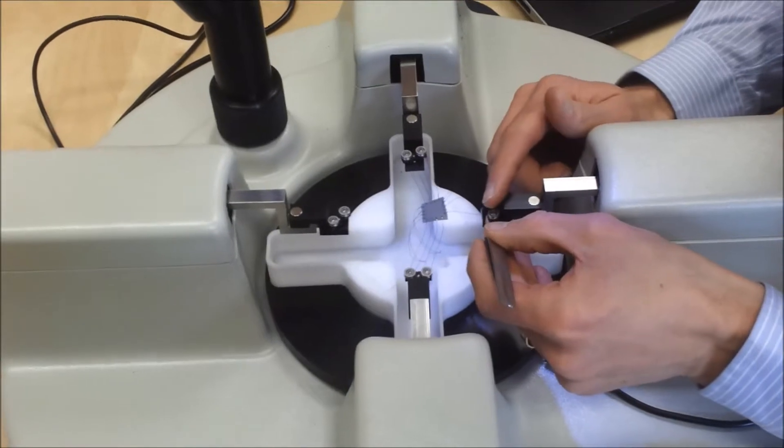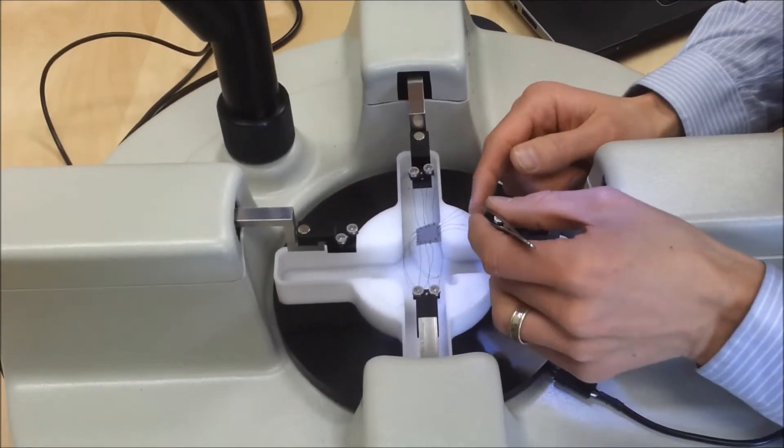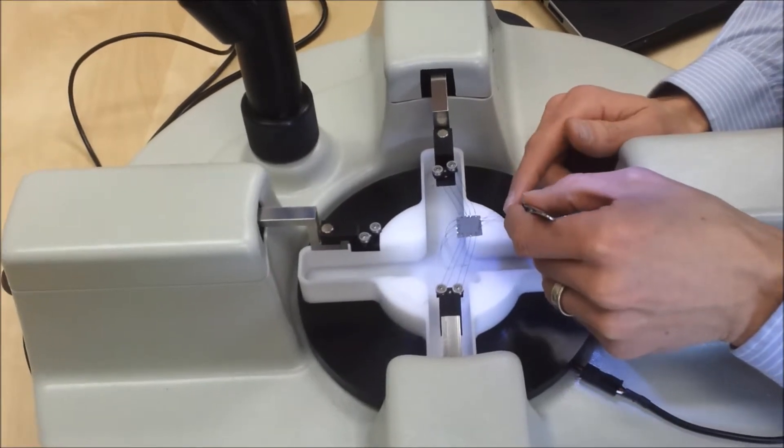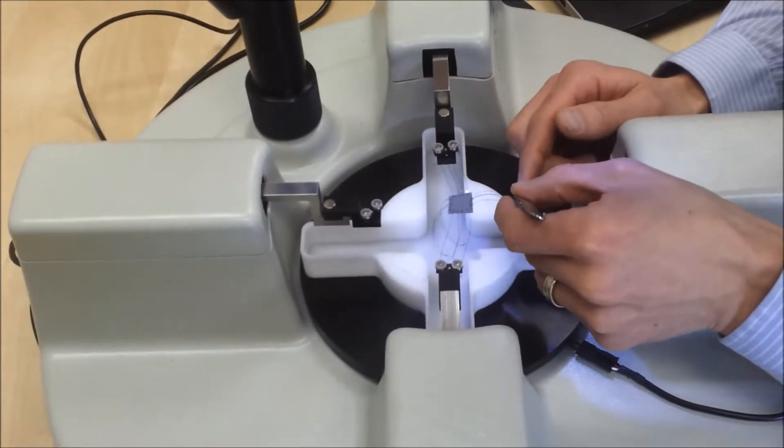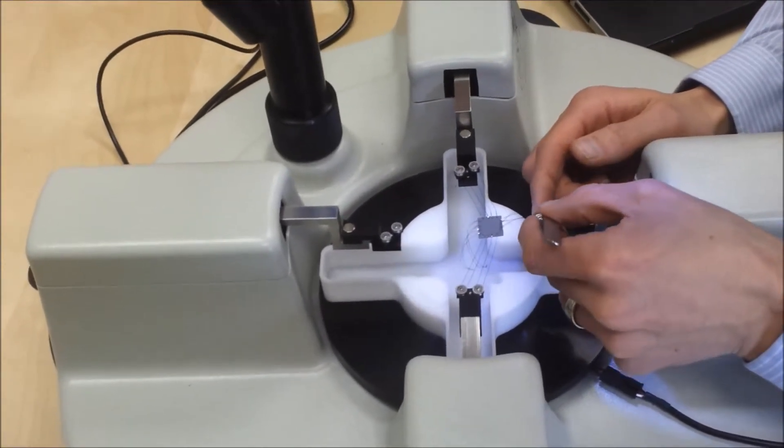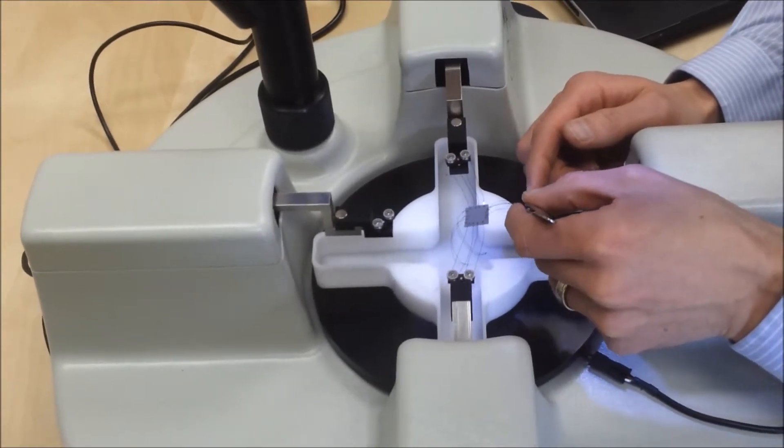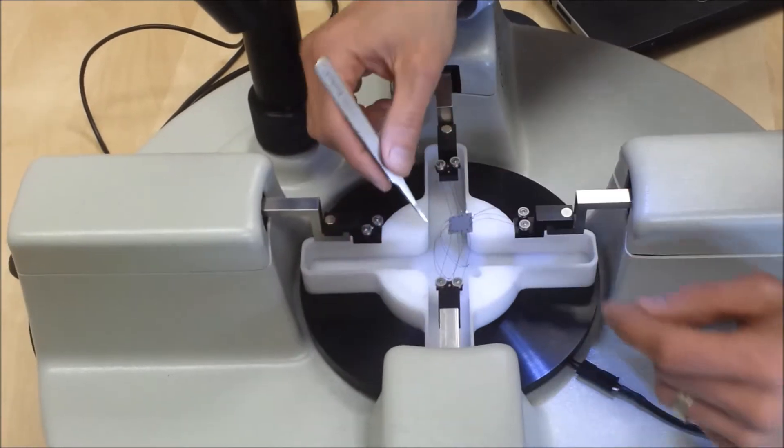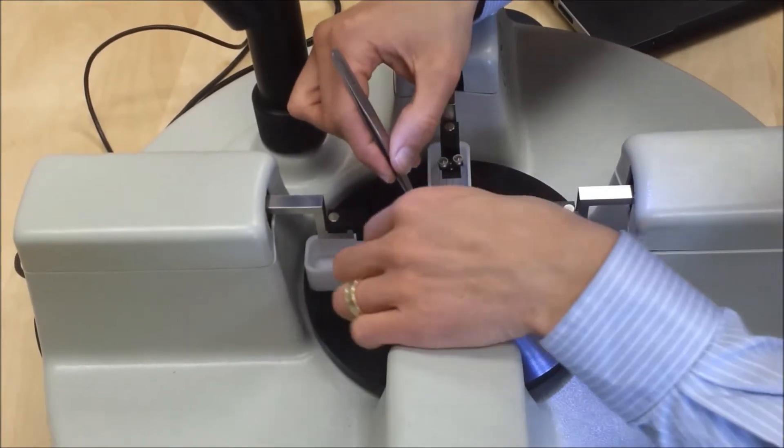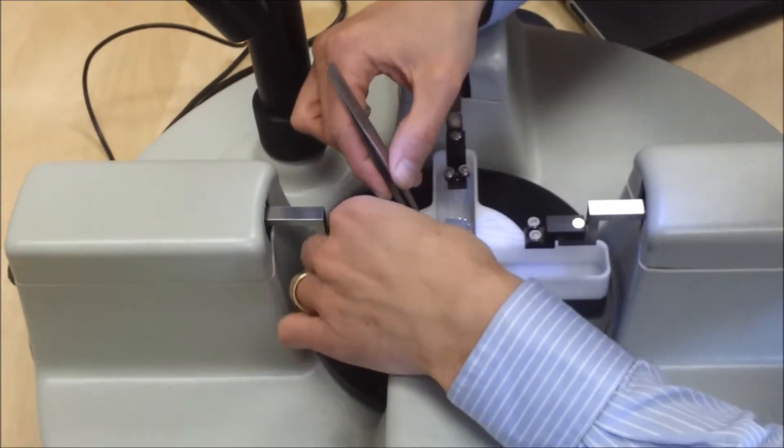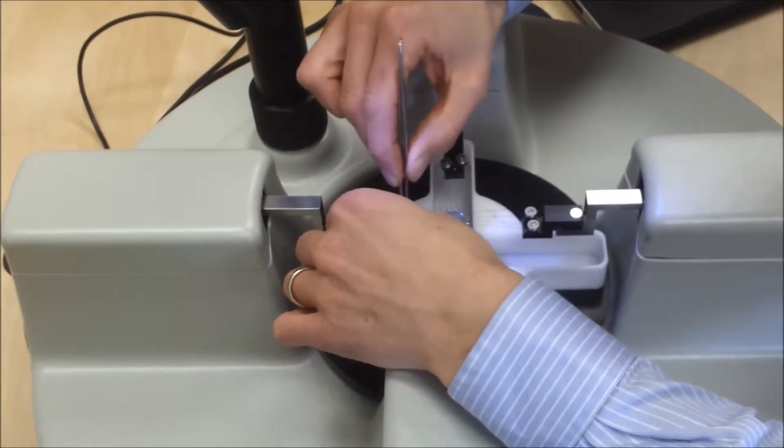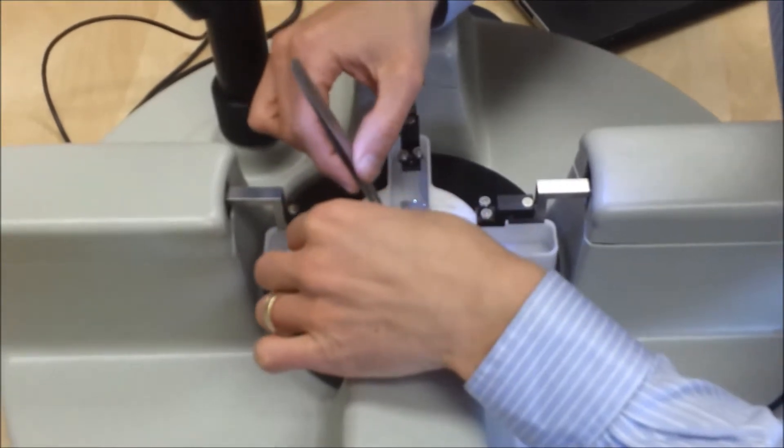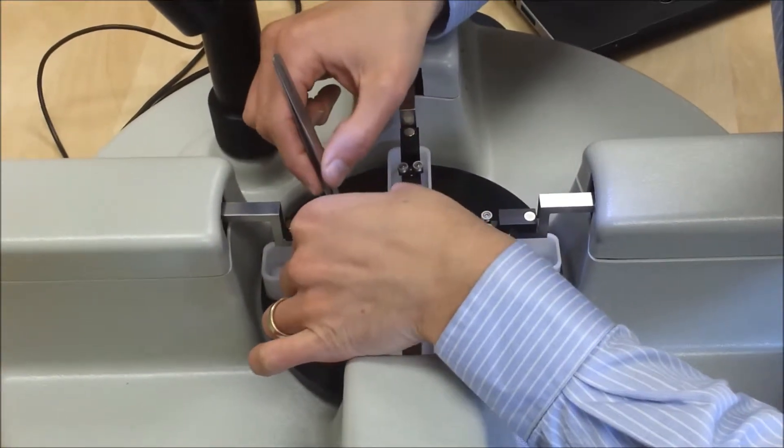I'll start here on the near side to me, actually. And I'll loop those suture lines over those pulleys on this side. Oops, I'll lose that one. Like so. And then I'll go to the far side. There, and just one more.